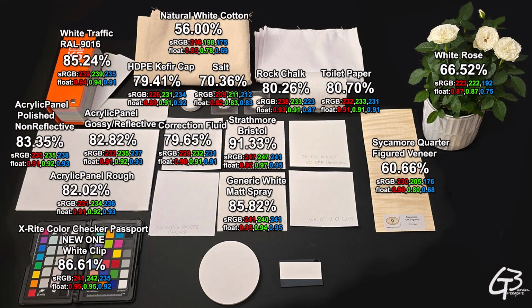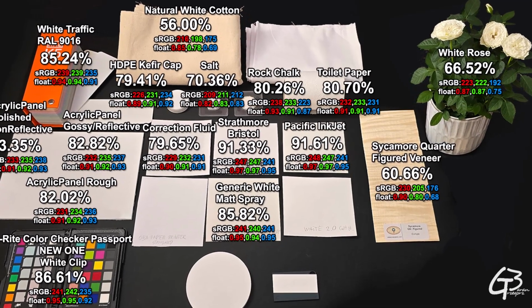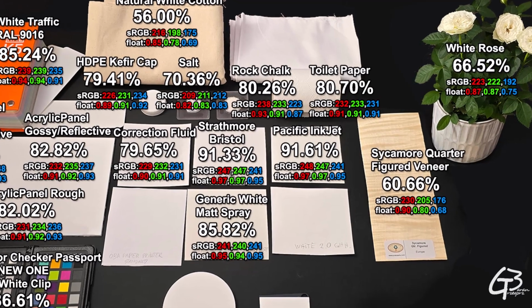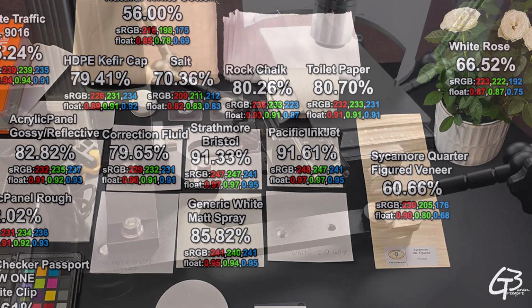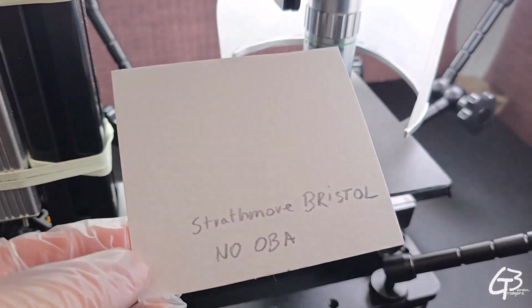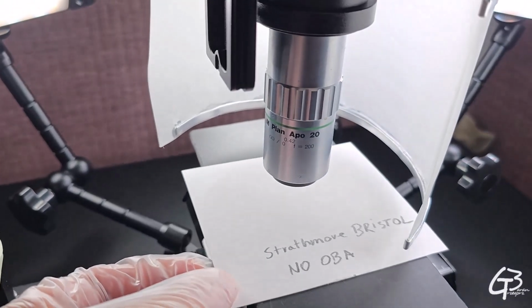The samples of non-OBA Strathmore Bristol paper and the non-OBA Pacific Inkjet paper are at 91% of whiteness. Since both are non-OBA, they give very similar readings regardless of being measured with or without the ultraviolet component. This is the Strathmore Bristol under magnification.